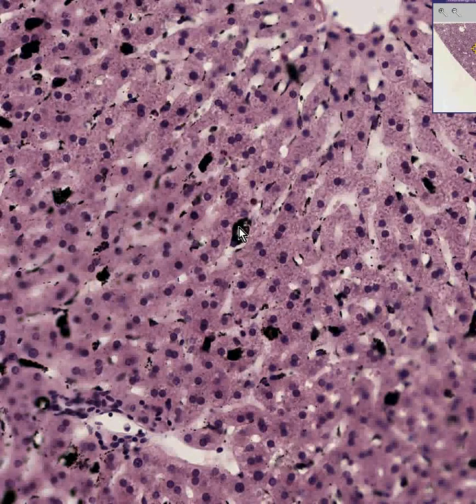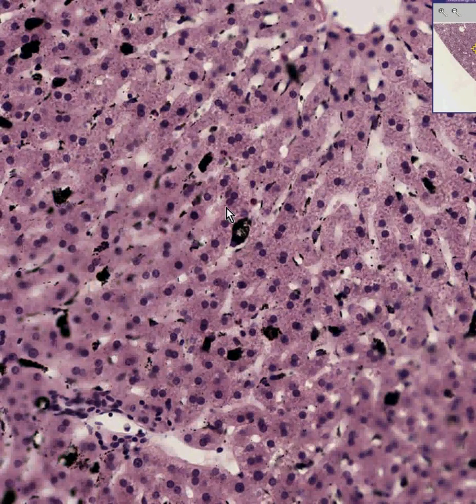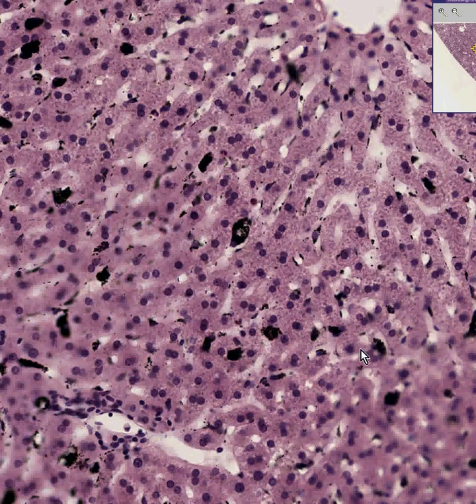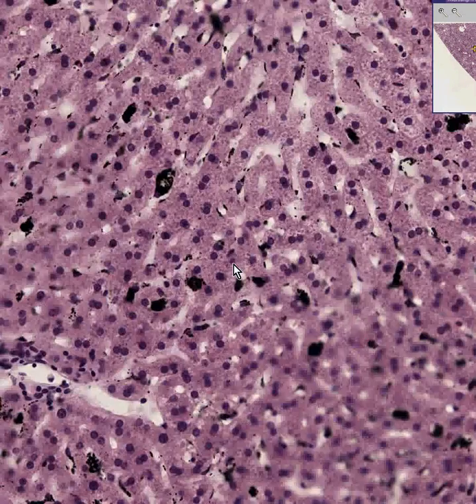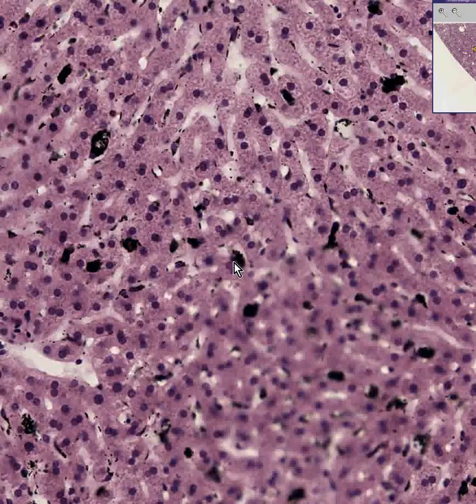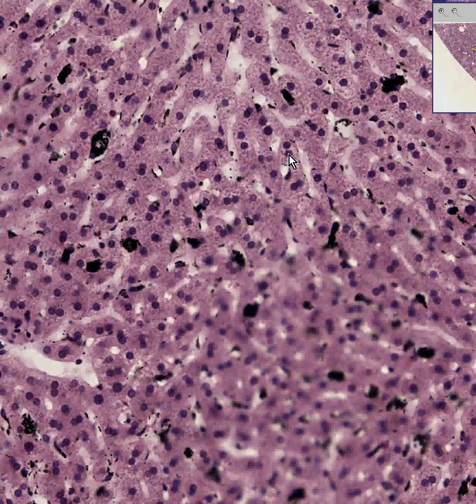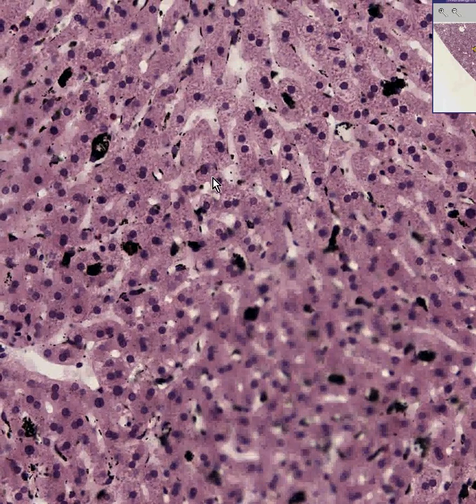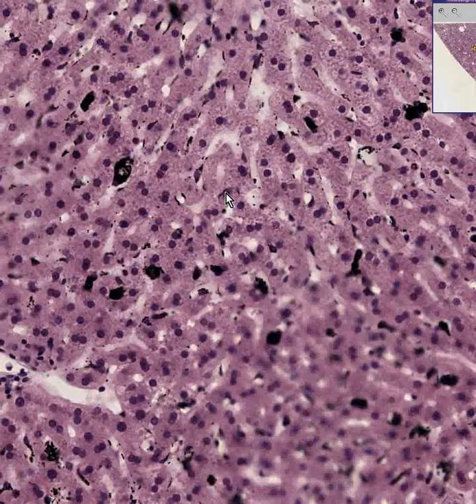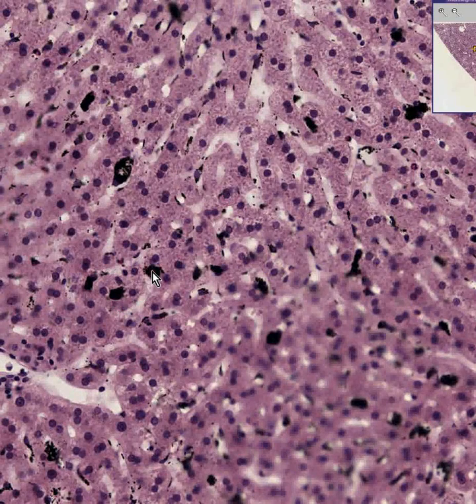So the Kupffer cells, which have macrophagic properties — here, and here, and here — are gobbling up all these particles, and the hepatocytes do not have macrophagic properties.